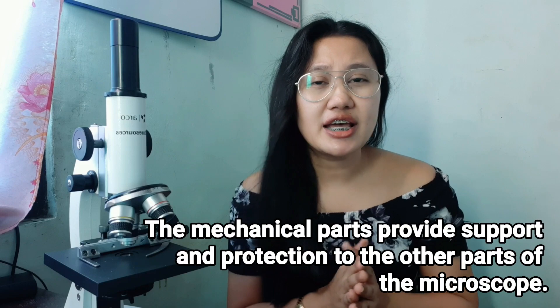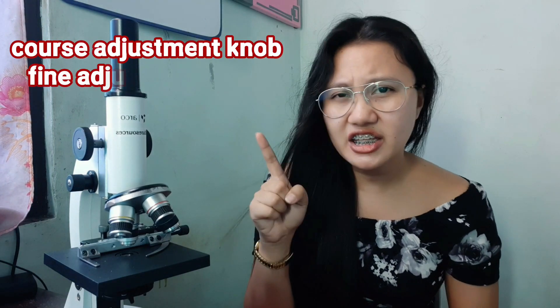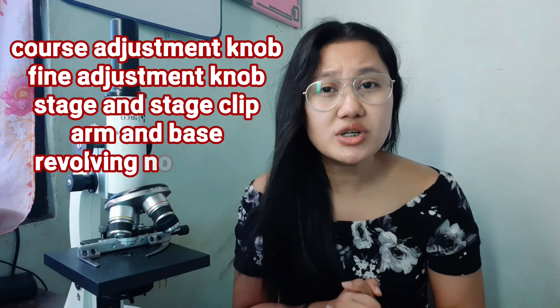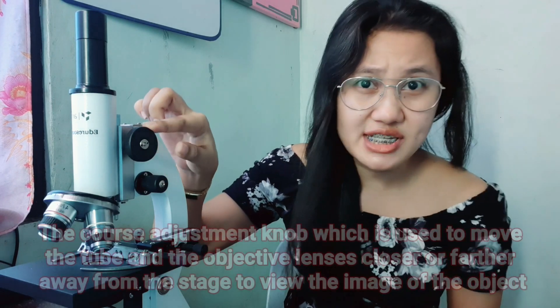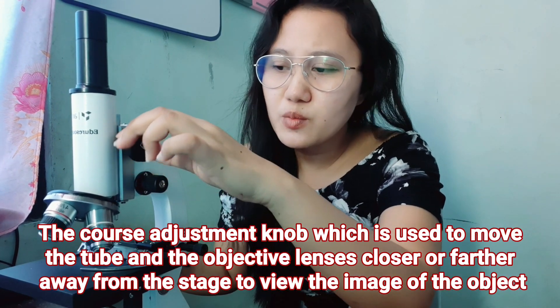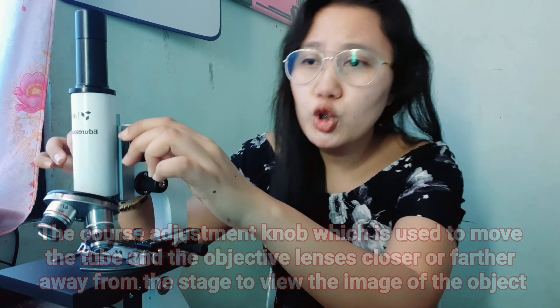The third part is the mechanical parts, which provide support and protection to the different parts of the microscope. The mechanical parts include the coarse adjustment knob, fine adjustment knob, stage, stage clip, arm, base, revolving nose piece, and body tube. The coarse adjustment knob moves the tube and objective lenses closer or farther away from the stage.